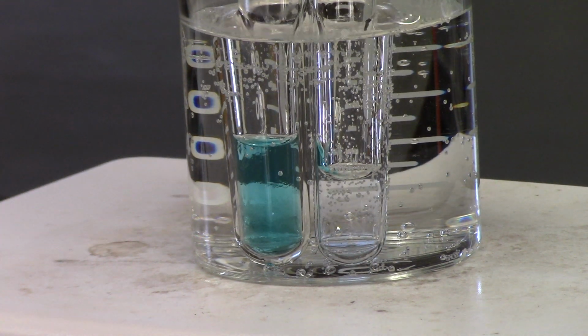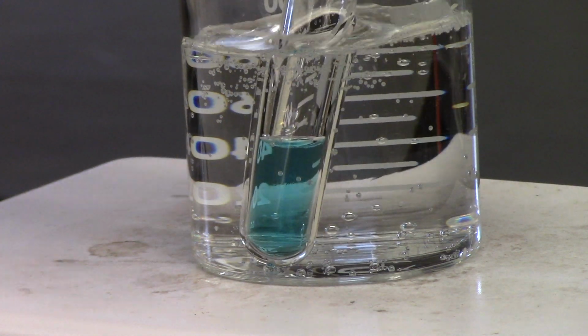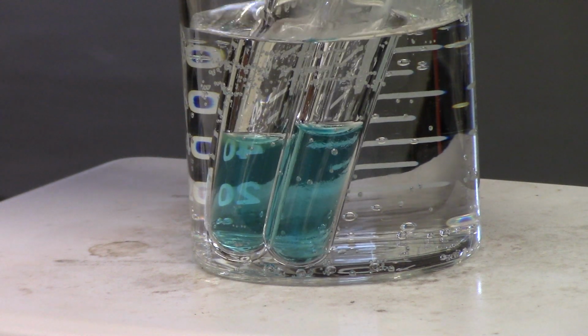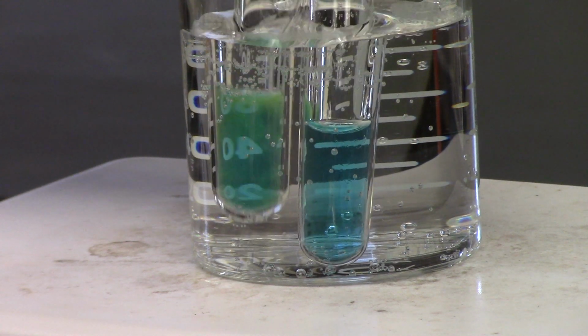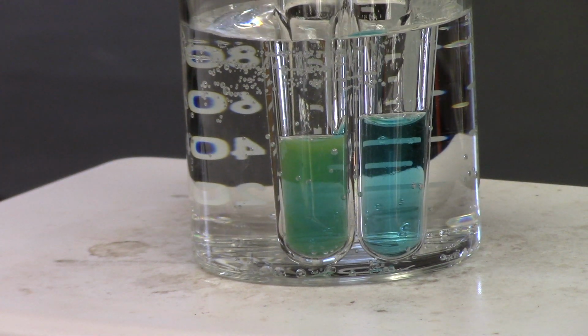Put it in the heat. Now I'm going to warm this bath. It's warming up now. I want it to kind of get close to boiling, if not boiling. We may see the result before boil, though. Let's keep that in mind. All right. There. Now we're just going to let them sit in the solution. This one here is glucose. This one here is sucrose. All right. So now we just sit and we wait for something to happen.